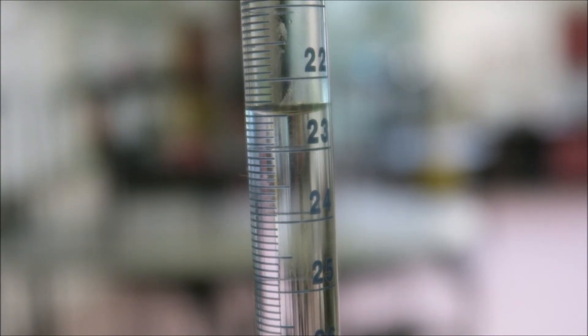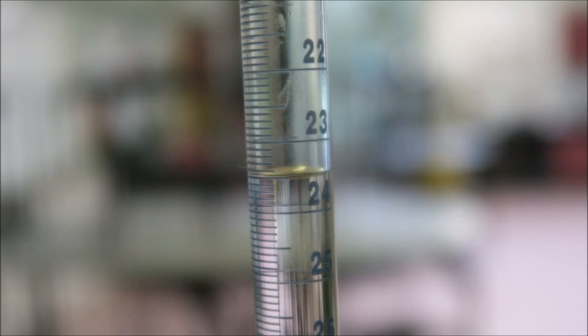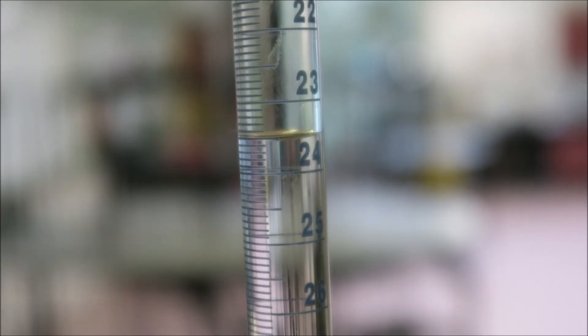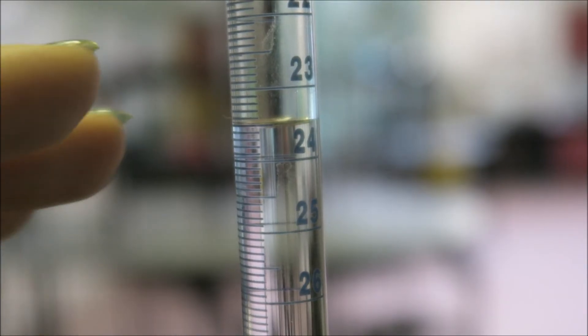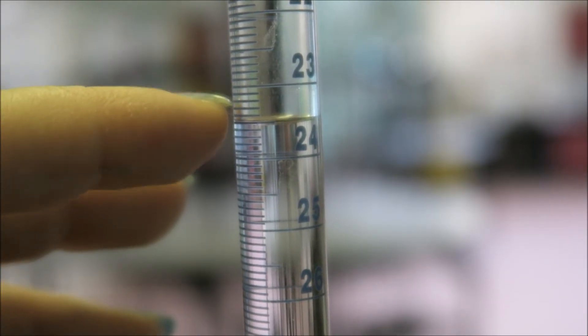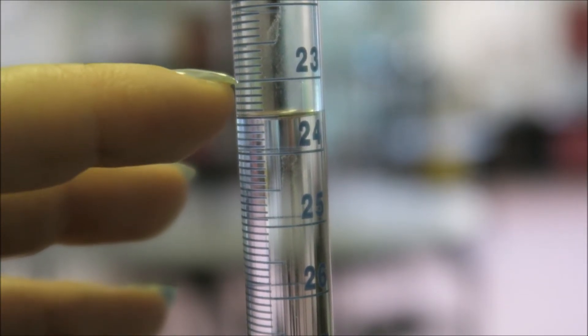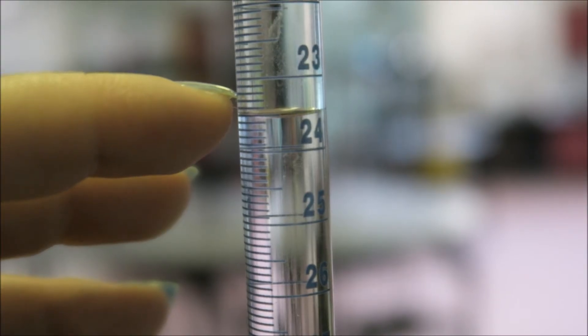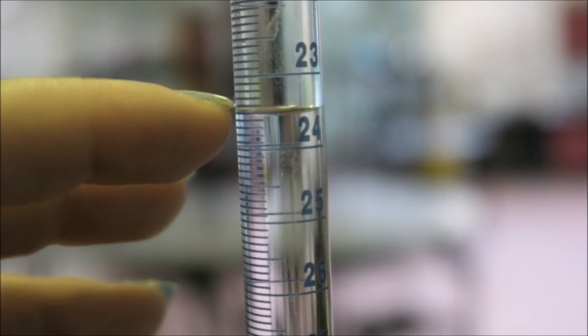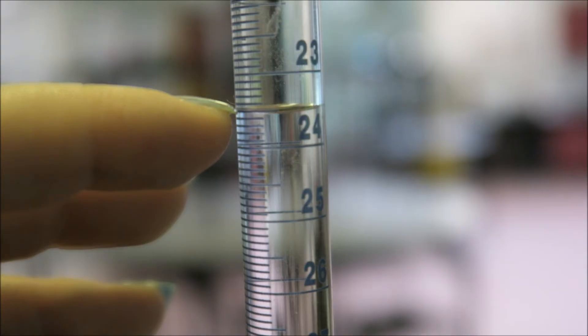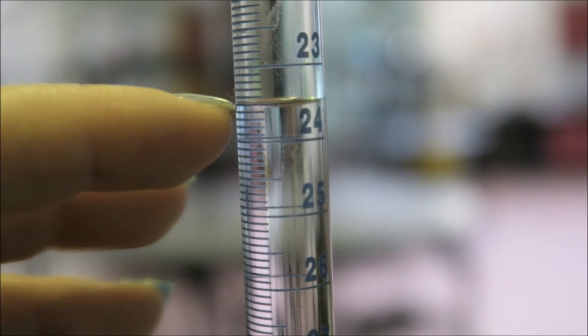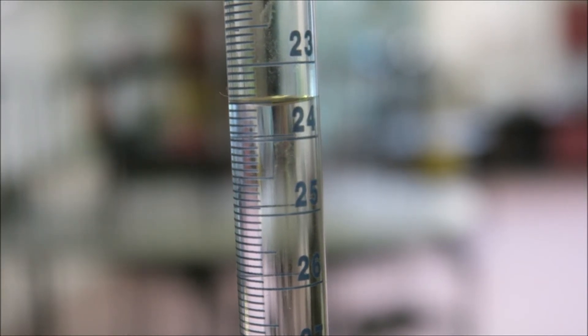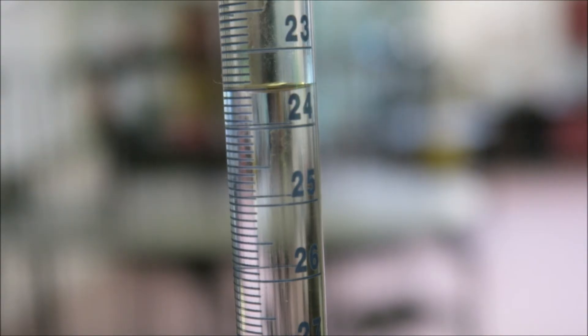If I just run a bit out. Okay, now what is this reading on a burette? Here we have 23, 24, 0.1, 0.2, 0.3, 0.4, 0.5, and then we can see it's just past 0.5 but not quite 0.6, so this is 23.55, a bit more.